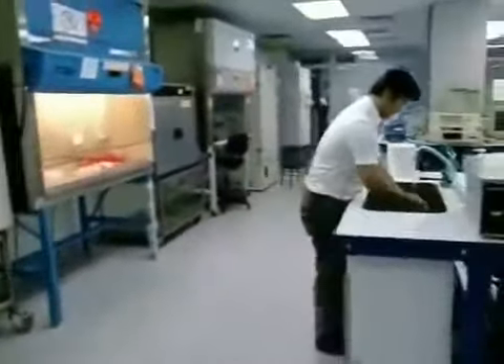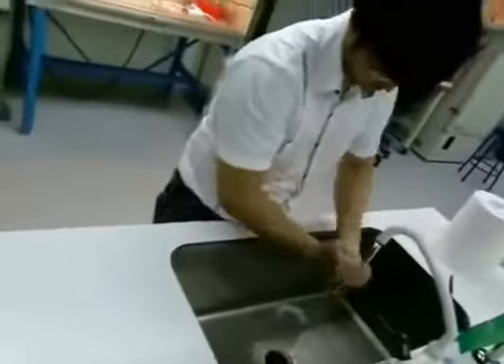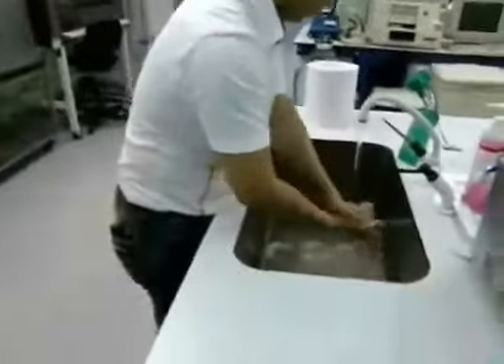Next, wash your hands thoroughly after removing PPE. You may now inform the others to return to work, now that the spill has been safely cleaned up.